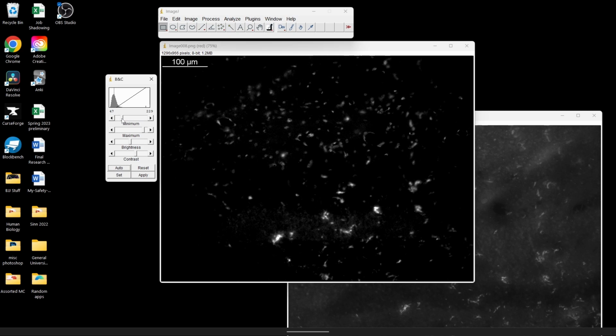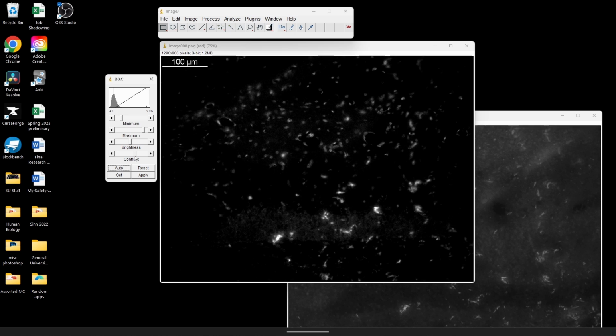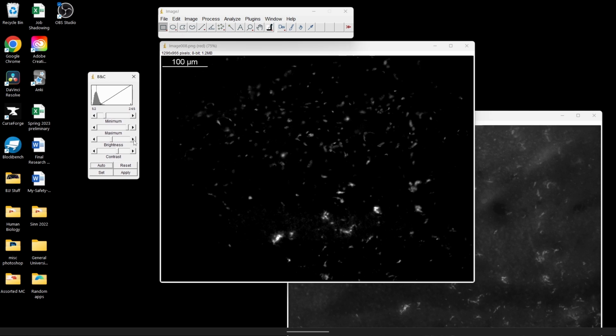And now I've got to up the contrast to the point where I no longer see some of that non-specific staining where all those cell bodies were. Because I know that my stain is not supposed to be in that area. And I don't really want that color anywhere that the antibody is not supposed to be. The best I can anyway. So I like that. We're going to go to apply, same as before, and fully apply it.